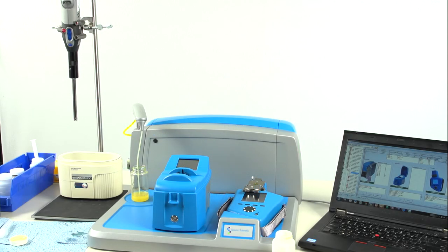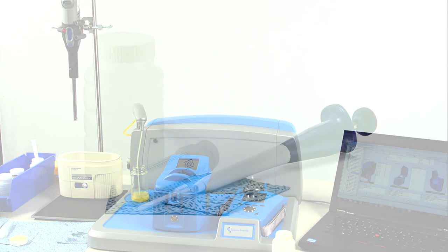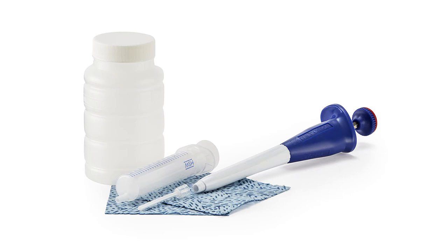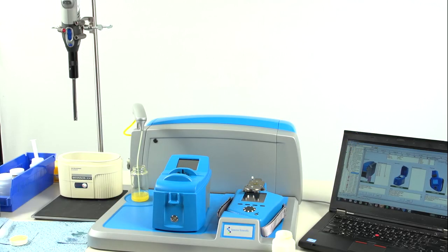The LNF can process undiluted samples up to 320 centistokes. For heavier oils, a simple dilution can be made using the standard MiniLab 53 consumables kit.